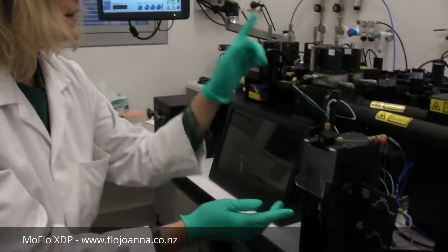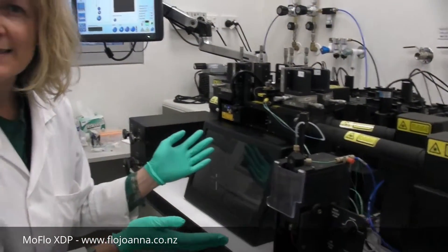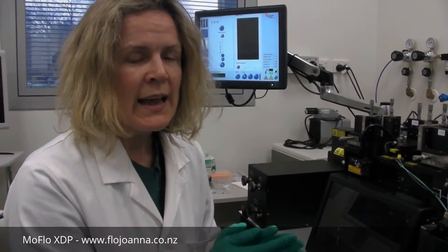With this instrument you can put your cells on here, run them through the system, identify the cells of interest, ask the instrument to sort them, and come away with a tube of cells of say 95 to 99% pure, depending on the starting population.